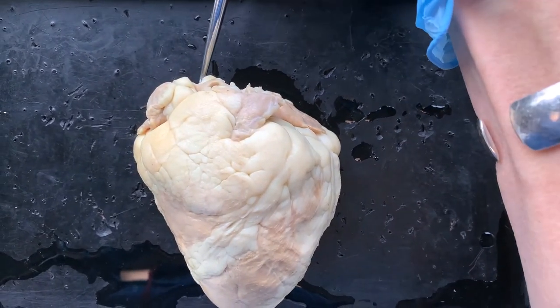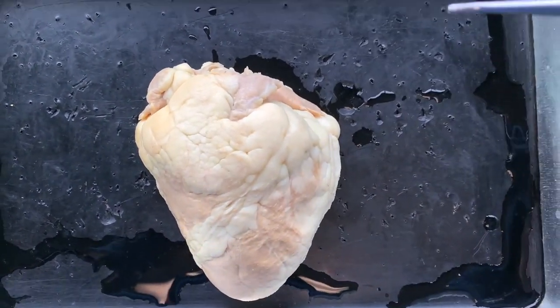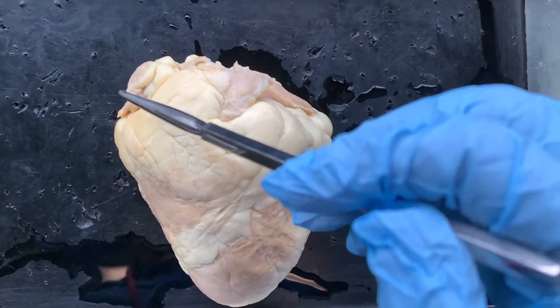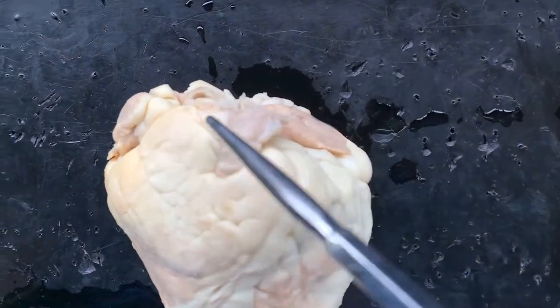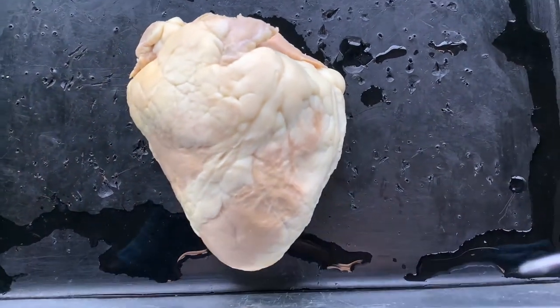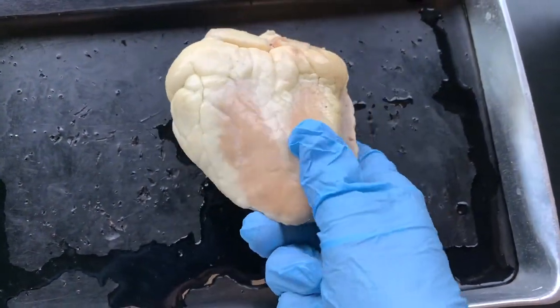You'll also see the superior and inferior vena cava on the sheep heart, on the right side, going into the right atrium. Here's that little right auricle — that right ear of the heart. And then here's the left auricle, that left ear of the heart. Those are just things to help you out based on what we did in laboratory with the human heart.